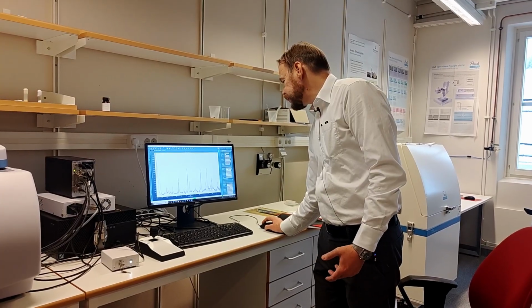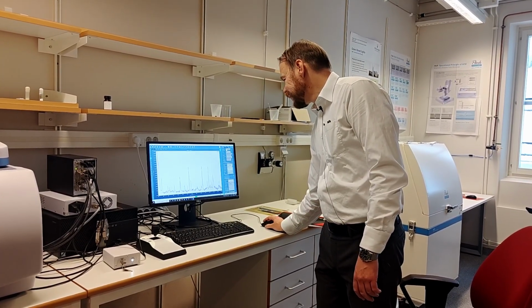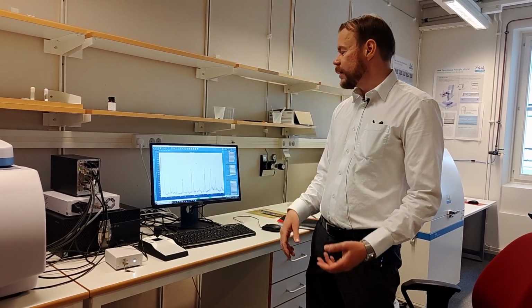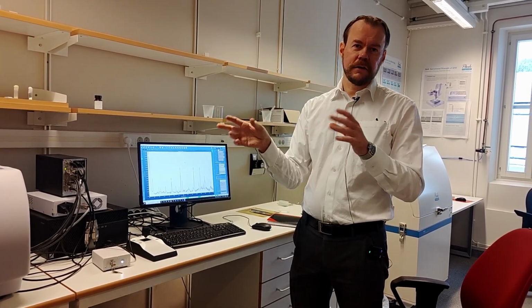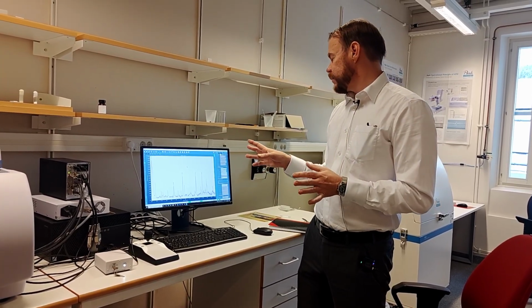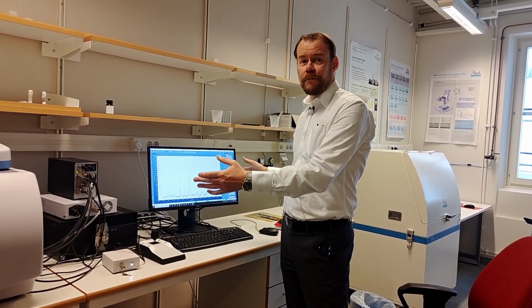And then, let's say we want to save a little bit of time also, so I put it down to 30 seconds. And then we scan. What will happen now is that the machine will scan as long as it can, and then it will reposition that grating in the spectrometer and then continue the scan. So it will be 2 consecutive scans that will be merged together. That is very nice, because then you have the resolution of the grating and you have a broader view field.